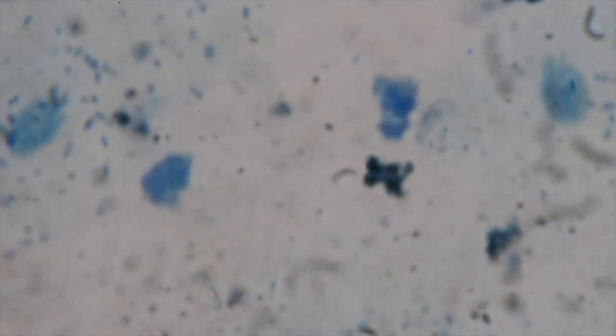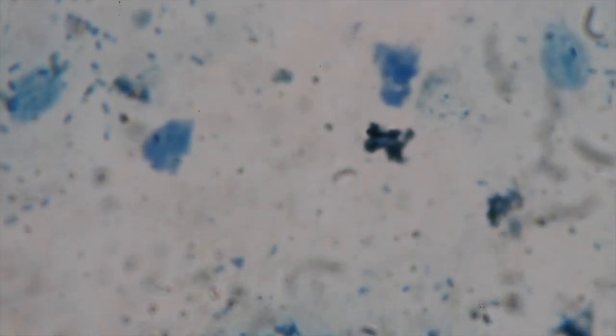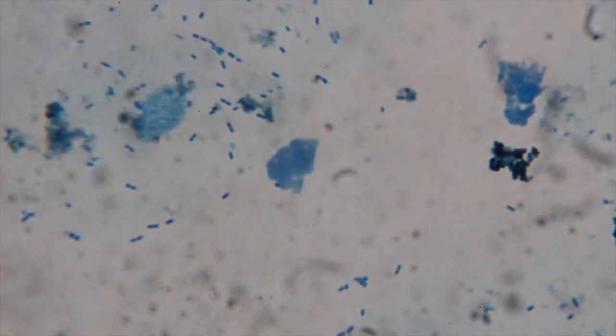And you can see the, oh man, my bad. So we can see all these tissues. So I gouged my tissue really well. And then we can get those bacteria.